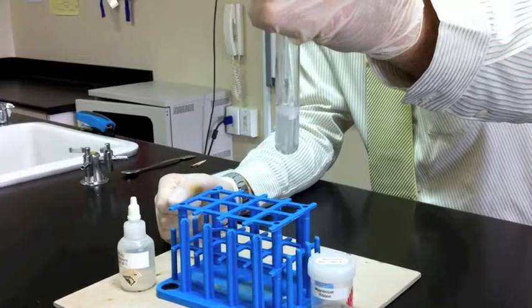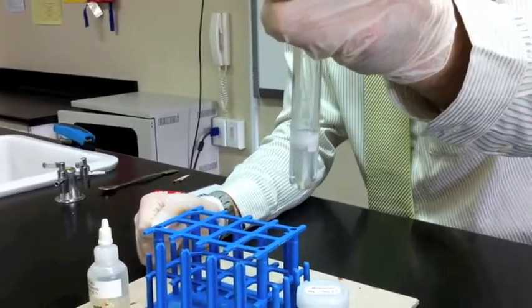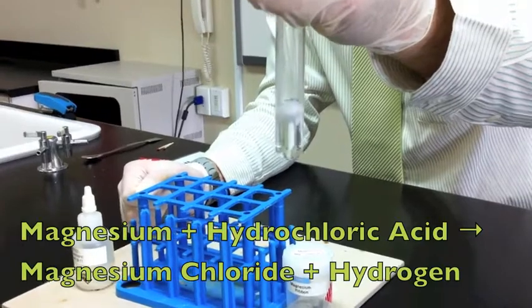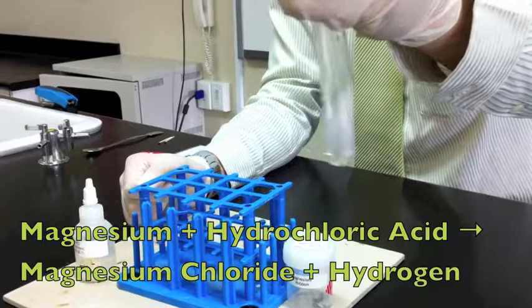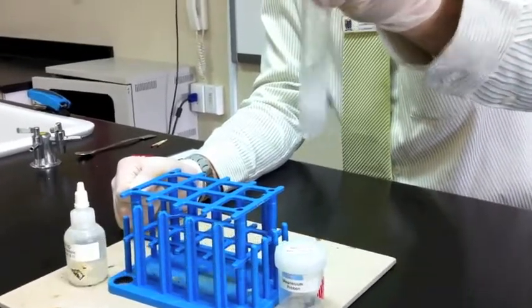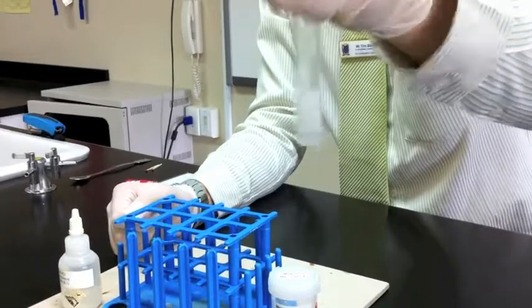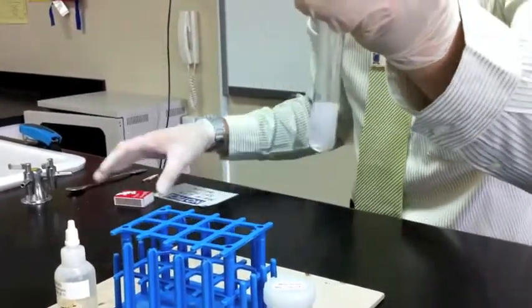So you can see that fizzing up, and what's happening there is actually the magnesium is reacting, or a chemical change or chemical reaction is happening, and the magnesium is changing with the hydrochloric acid into something called magnesium chloride, and hydrogen gas is also being produced or released. So I'm going to just check to see that that's hydrogen gas, because what happens when you set hydrogen gas on fire is that it explodes a little bit. So here's a chemical change, magnesium ribbons reacting with hydrochloric acid to form hydrogen gas and magnesium chloride.